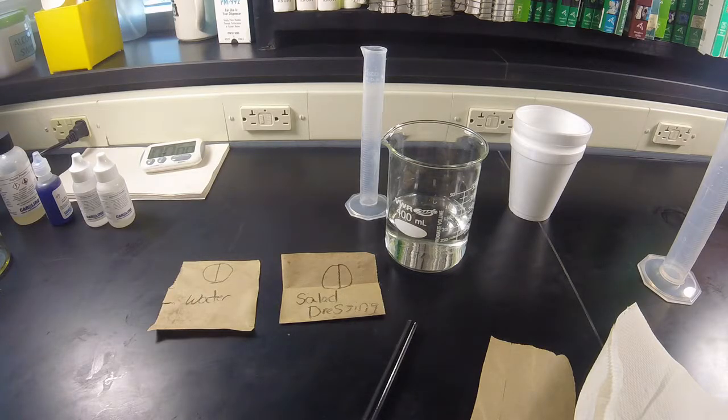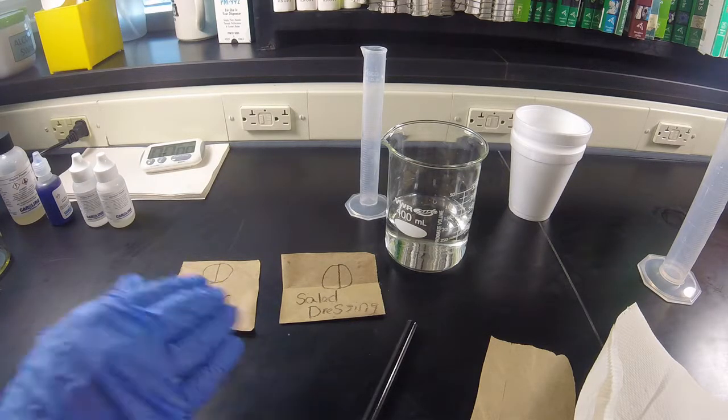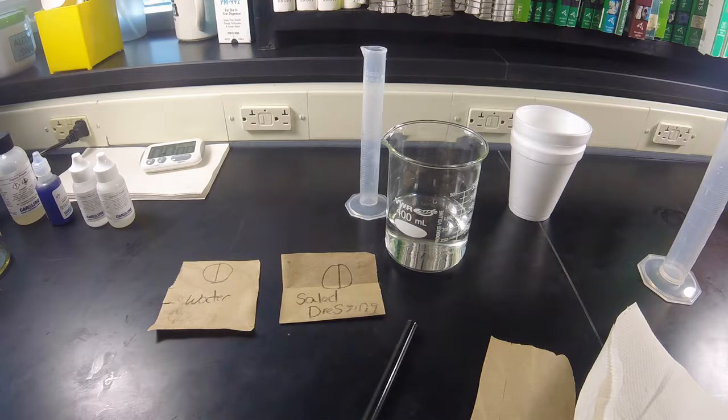For the purposes of this demonstration, I will only be using water and salad dressing. In your lab, you are required to have 8 different tests.